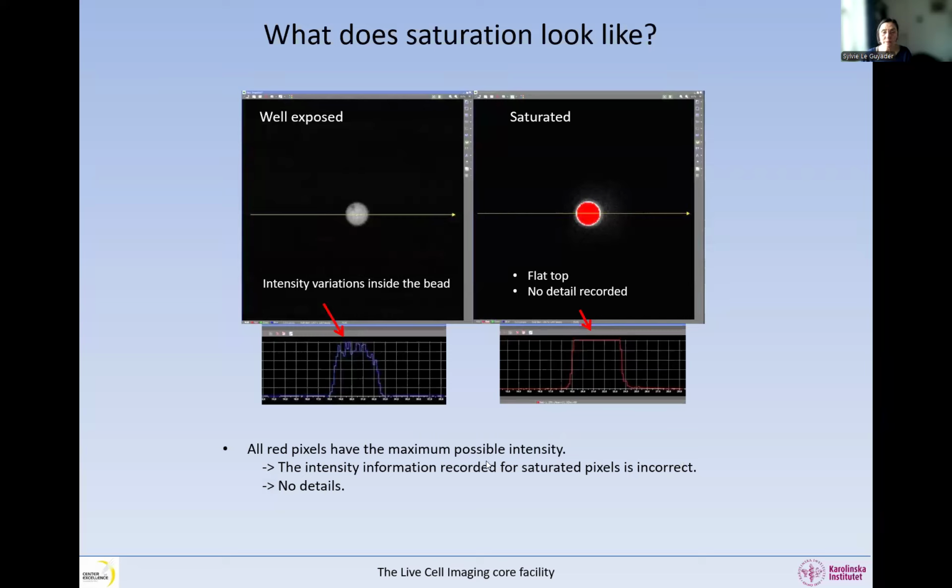So there are no details at all, and what we need to do to correct for this is, for example, change the exposure time, expose less. If we have a camera-based system, we can lower the gain, we can lower the illumination power, etc. But we need to put less light on this. And we need to be very aware when we do Z-stacks or time lapses, because then the intensity can change over time, and during a Z-stack, the intensity can change a lot over Z. Therefore, we need to be very conservative when we set the gain, the exposure time, and the illumination power. It's not only what we see in one plane or at one time point, because that is clearly going to change.